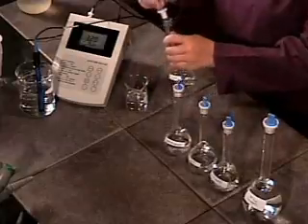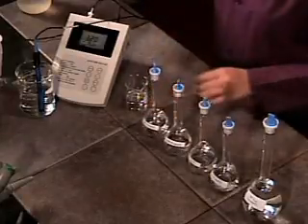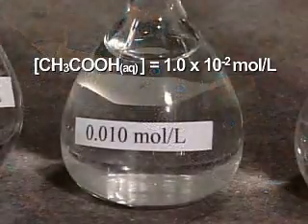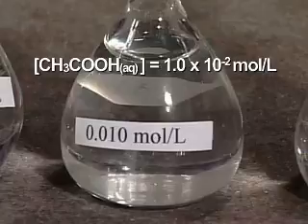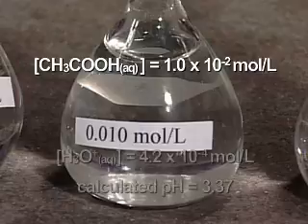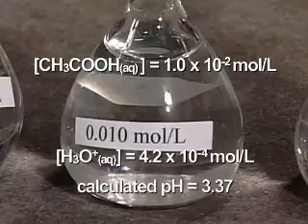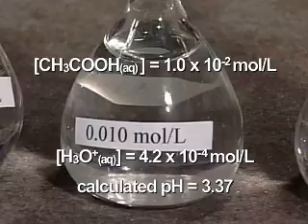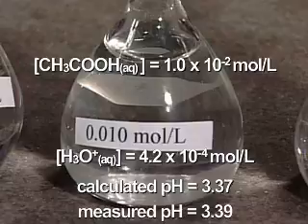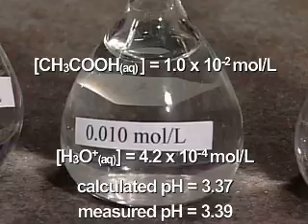A second, third, and fourth dilution are performed and in each case the pH is measured. After the second dilution, the concentration of the ethanoic acid solution is 0.010 mole per liter. 0.010 mole per liter ethanoic acid is 4.2% ionized. The concentration of hydronium ions in the solution is 4.2 times 10 to the negative 4 mole per liter. The measured pH is 3.39.